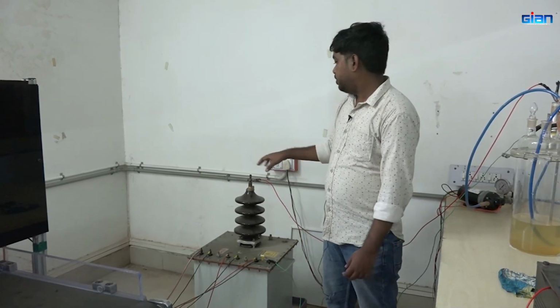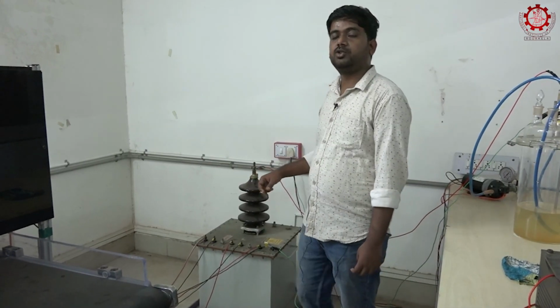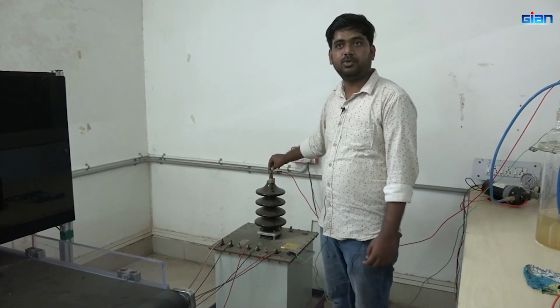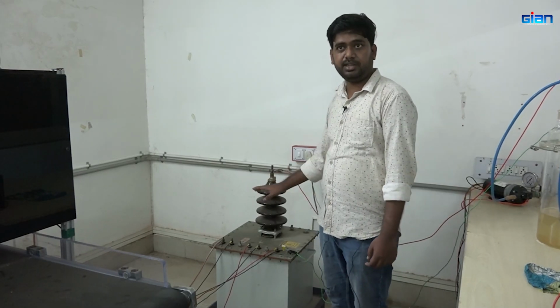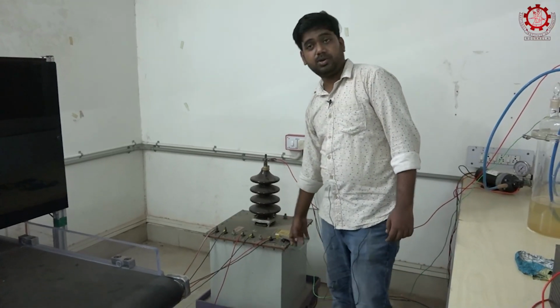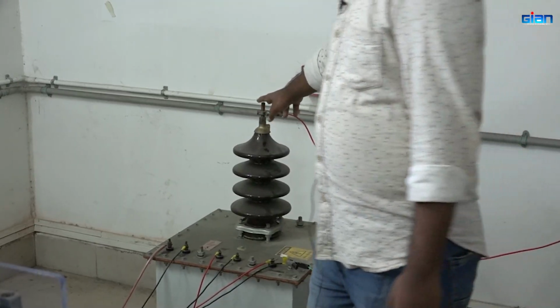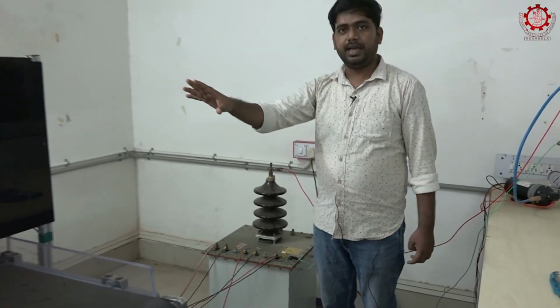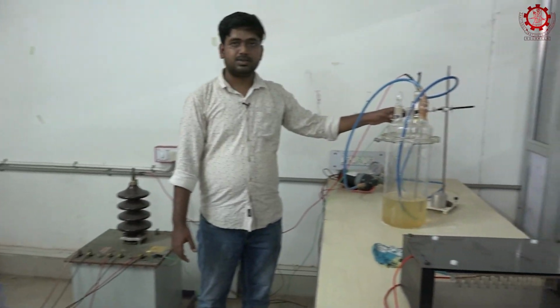So as we can see from the back, this is called a step up transformer. In our daily use, we use a 220 volt power supply. This step up transformer is mainly used to increase the voltage, up to 70 kilovolt. There are two connections: the green one is for earthing purposes, and the red one is the supply for the positive current. So this transformer can be used to operate the dielectric barrier atmospheric plasma, and it can also be used to generate plasma activated water.